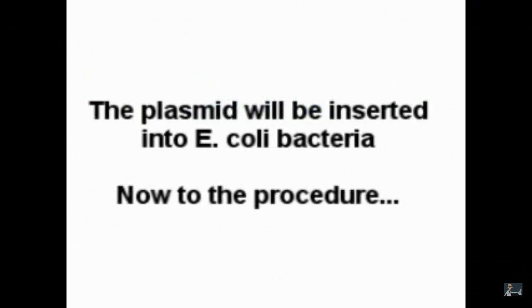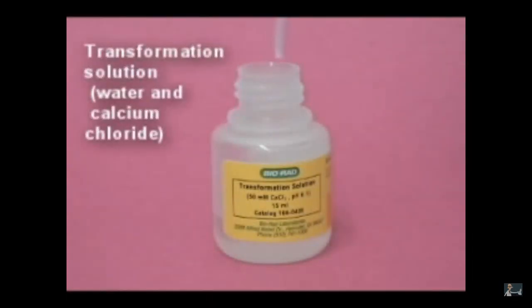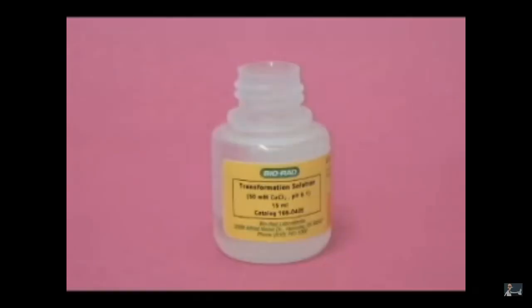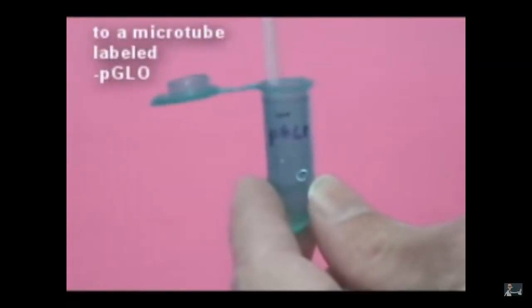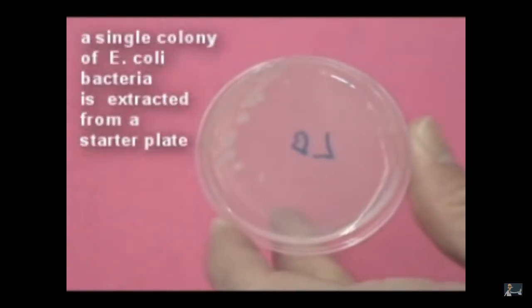So we're going to stick the plasmid into E. coli. So we have our calcium chloride transformation solution. We have our tubes labeled plus and minus. Remember, the plus tube gets the plasmid, minus tube does not. Then you add E. coli to each tube.